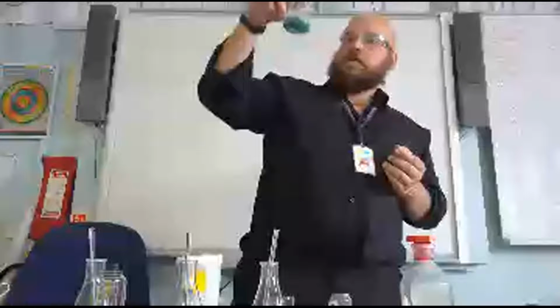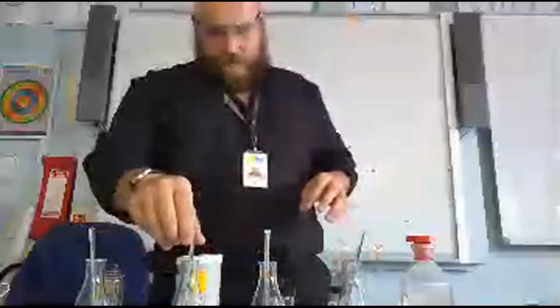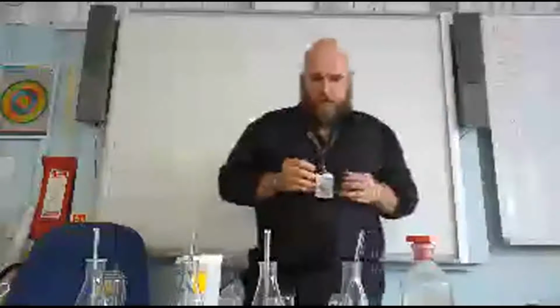All right. Good stuff. Okay, so I'm going to record the data now, and I'm going to put it back into the table over here, and then we'll see what you can do to process those results. Obviously, I don't want you to process it. I want you to use this video to answer the exam question that I've set you. All right. Okay, so I'll bring you back over to the main platform.